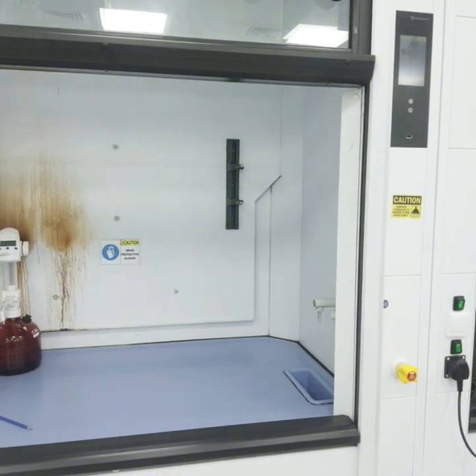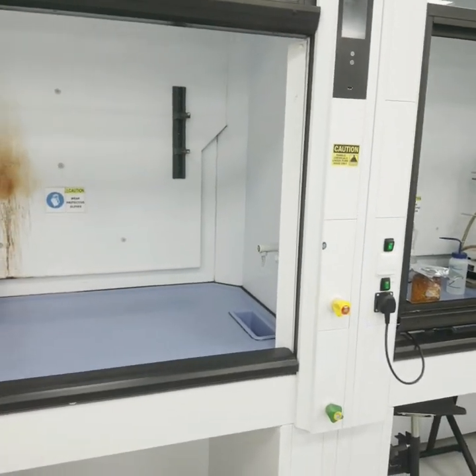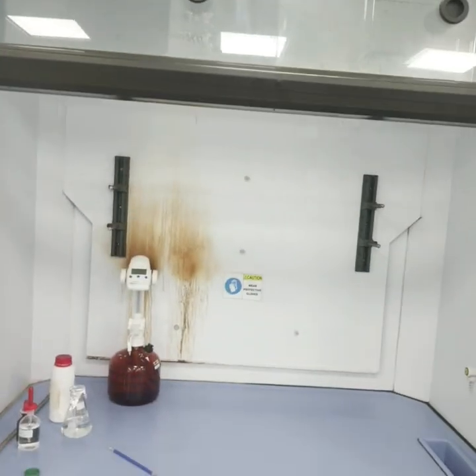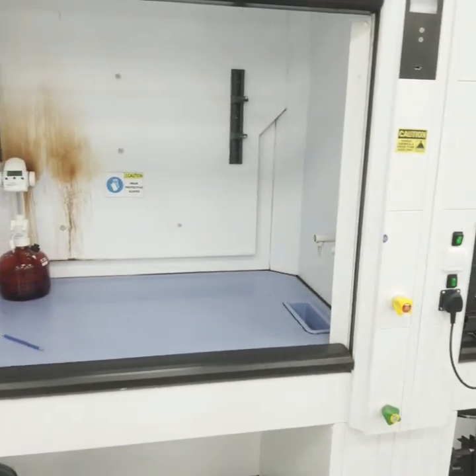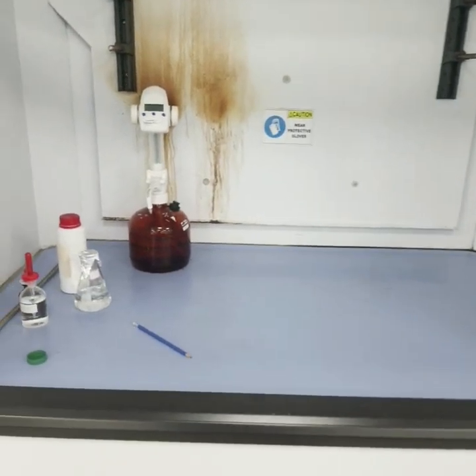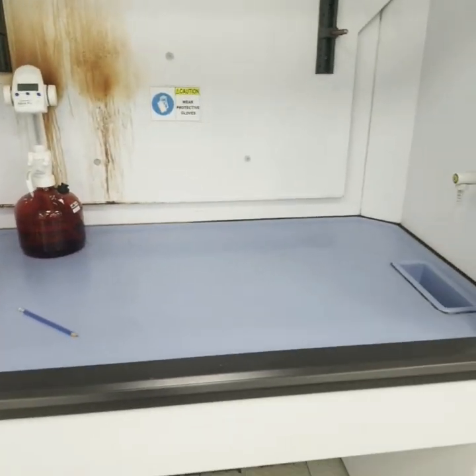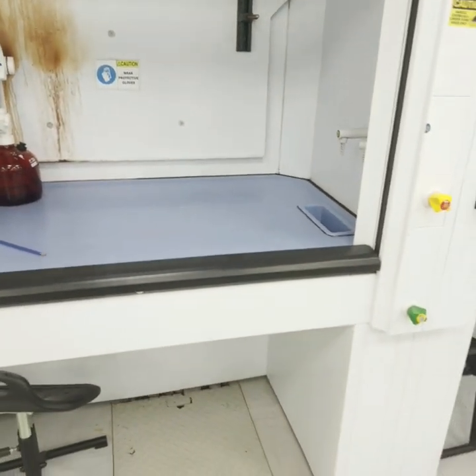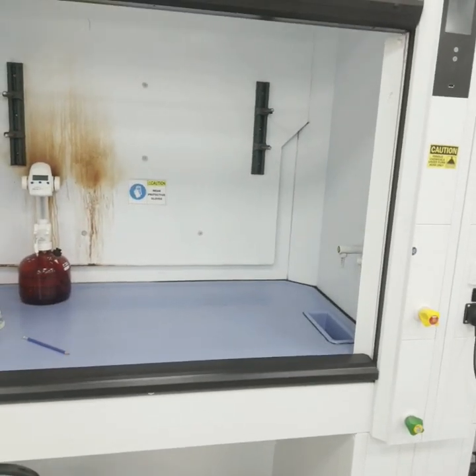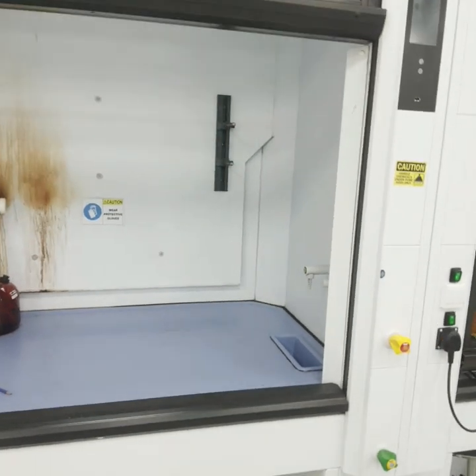There are different kinds of fume hoods available nowadays. We have ducted fume hoods — like the one shown here — ductless fume hoods, and special types. In terms of class, we also have Class 1, Class 2, and Class 3 fume hoods.